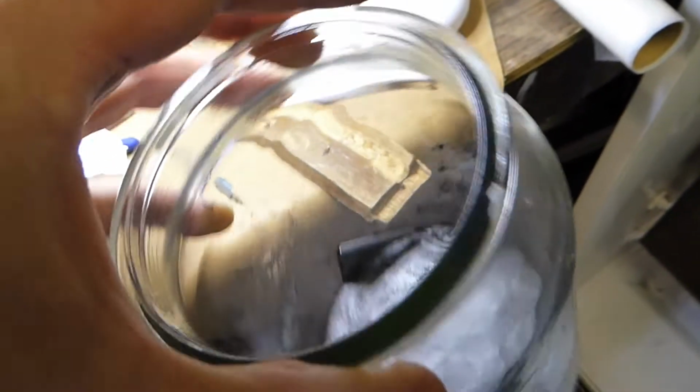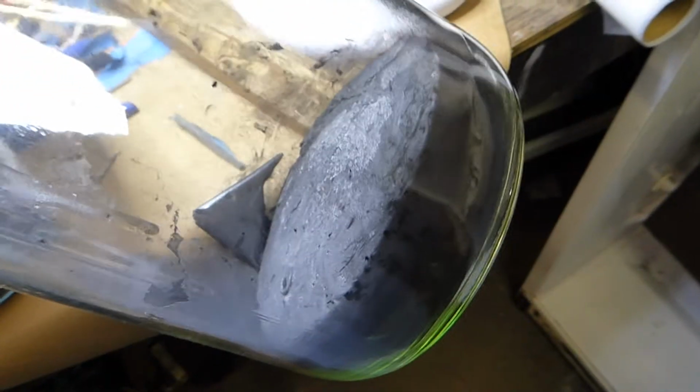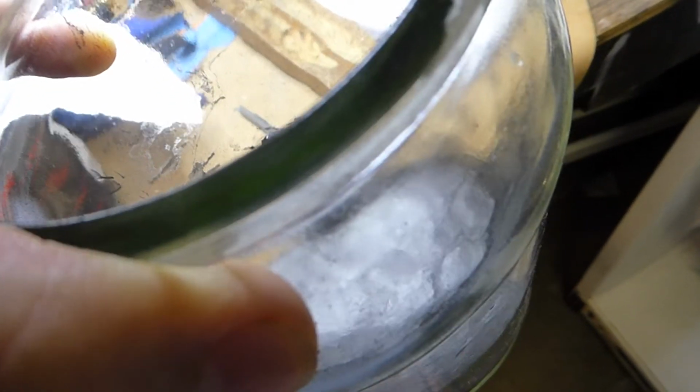Here's an interesting little failed experiment. This stuff here is polystyrene foam that was melted down in acetone, and then I put some graphite in there, and actually it was mass fraction graphite, graphene, sonicated stuff. So, yeah, I mixed it up and laid it out and tested the conductivity of a piece of it, and there was nothing from end to end.